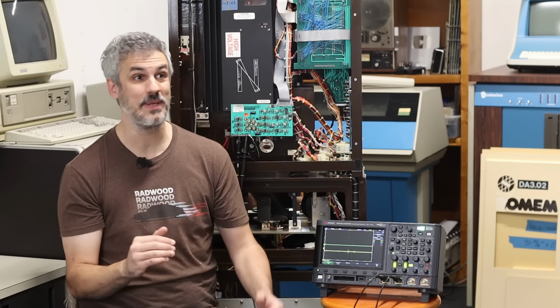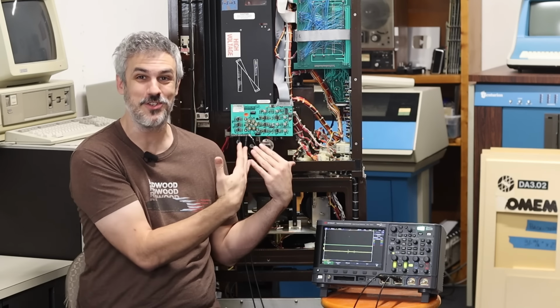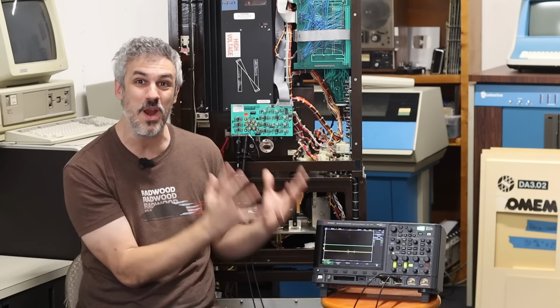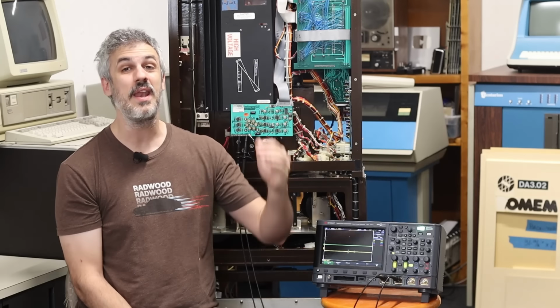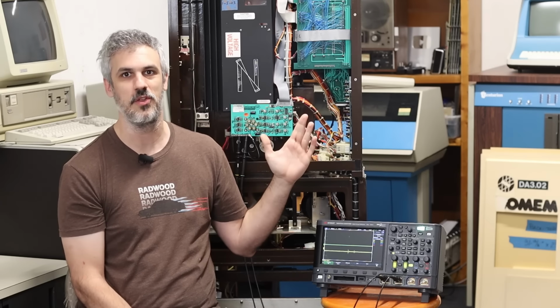And in the next episode, we're gonna try and hunt that down, because that's the only thing that's keeping us from having essentially a fully functional spectrometer. We are so close, but this failure is so interesting. Where's the noise coming from? This is gonna be a fun journey to figure out. So we got a phenomenal amount done. This machine is 99% of the way there, and we're gonna get it all the way there in the next episode.